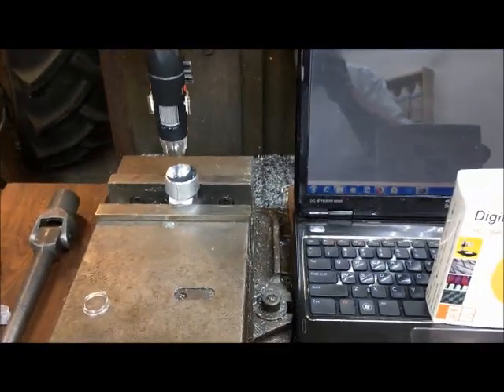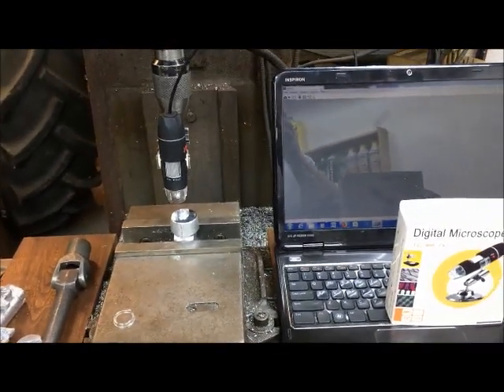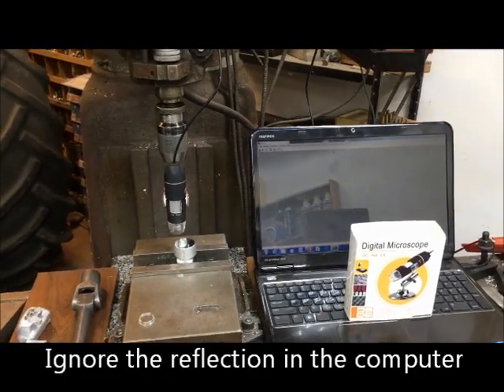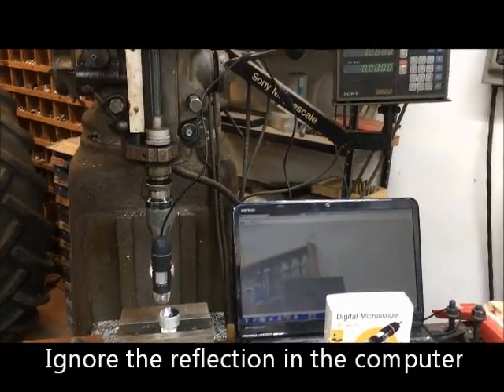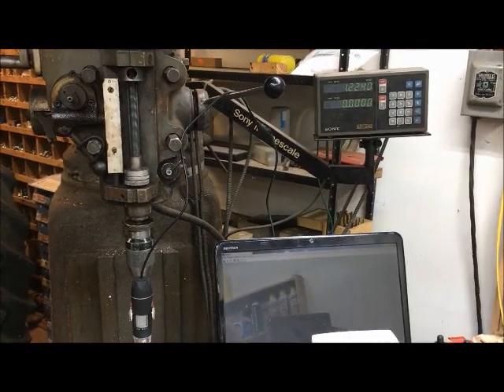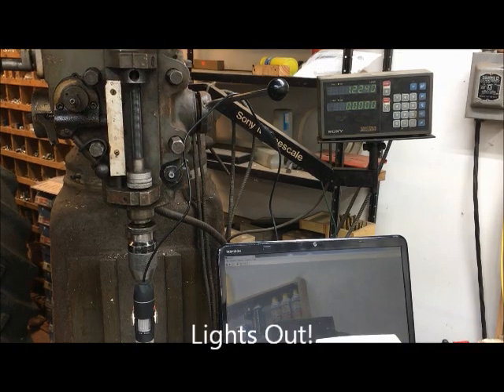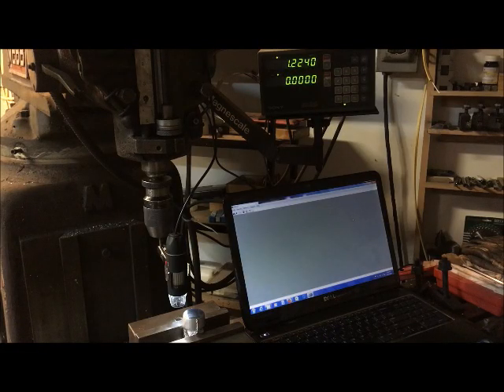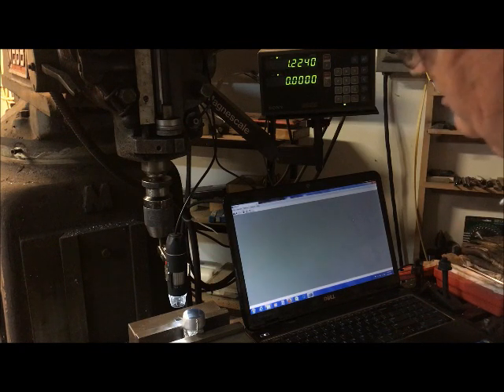This is my setup. I have the microscope in the chuck of the mill, and I'm using the mill table and the DRO, digital readout, on the mill to help me determine where I'm at on the piece. Okay, now I've turned off the light in this part of the room. I'd centered the defect on the screen and then moved it 1.224 inches.